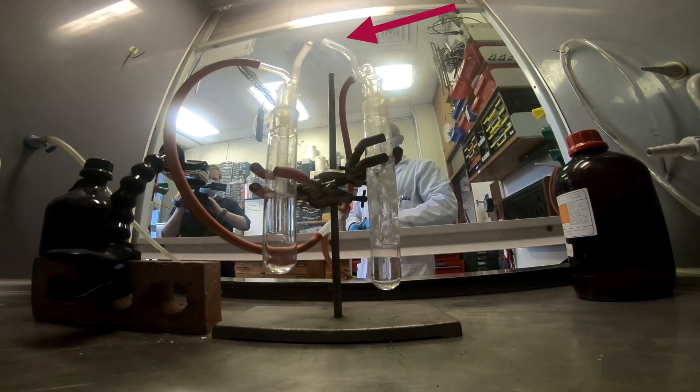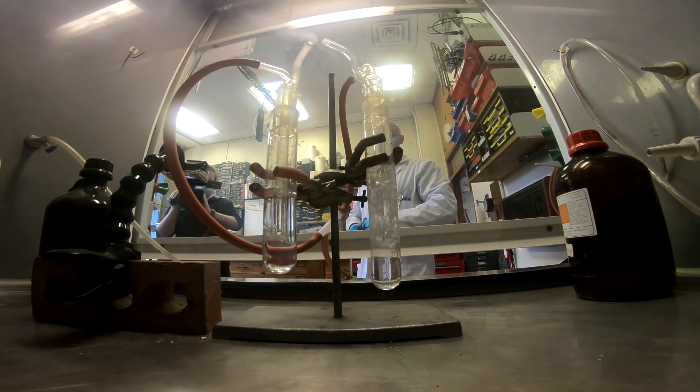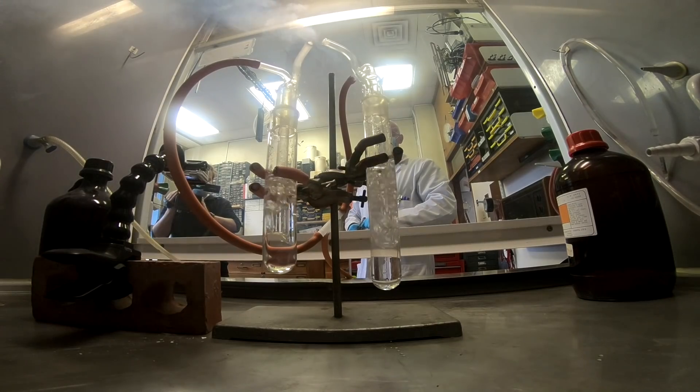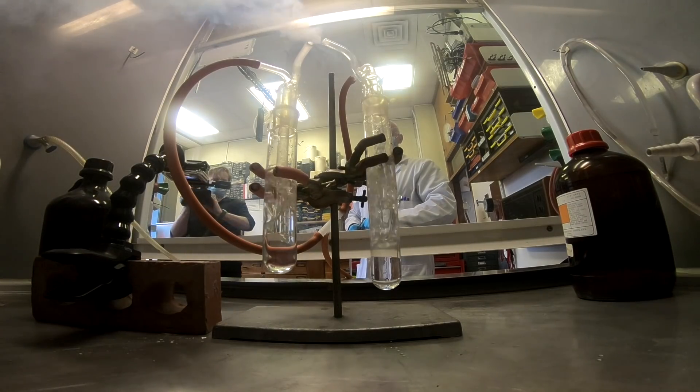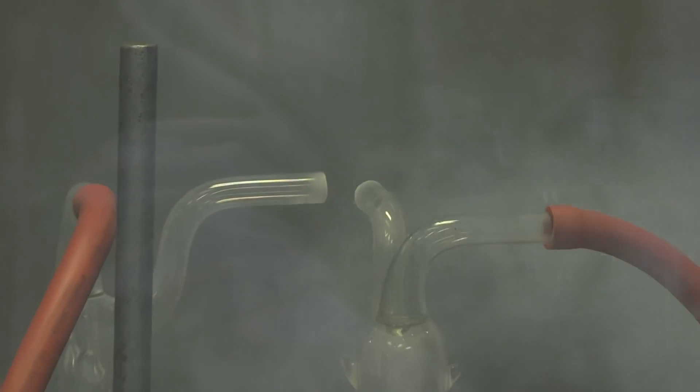Ammonia is dissolved in water. The HCl is dissolved in water. So to force them out, Neil blew in nitrogen gas into both liquids, and that nitrogen gas carried the ammonia and HCl out of the flasks and into the gas phase where they could mix.